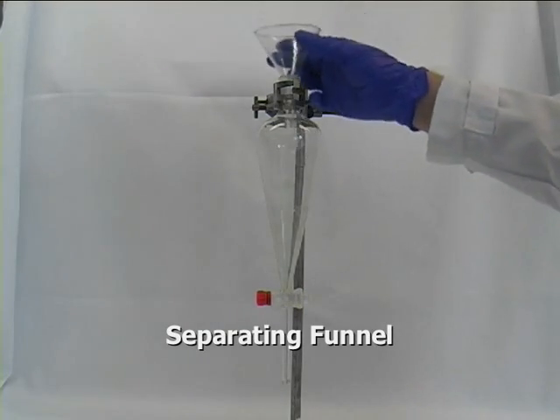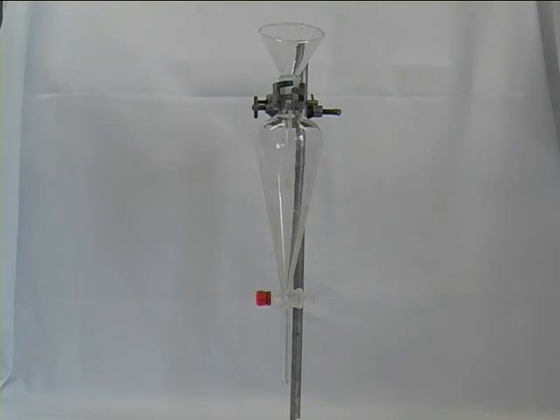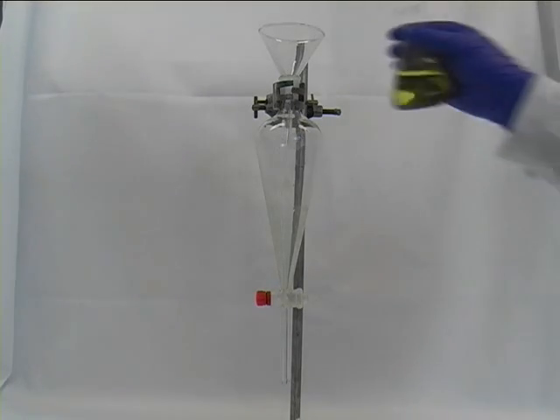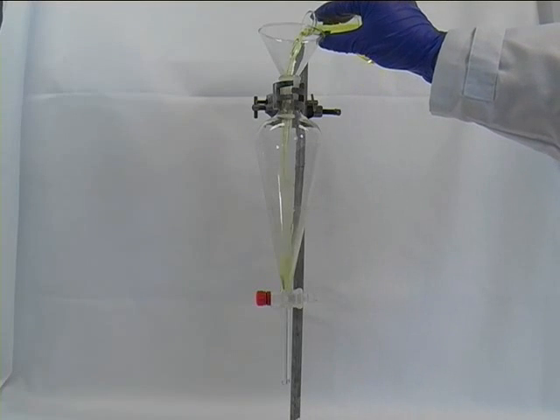You might want to use a funnel in order to fill the separatory funnel, and we are going to add first our organic phase.